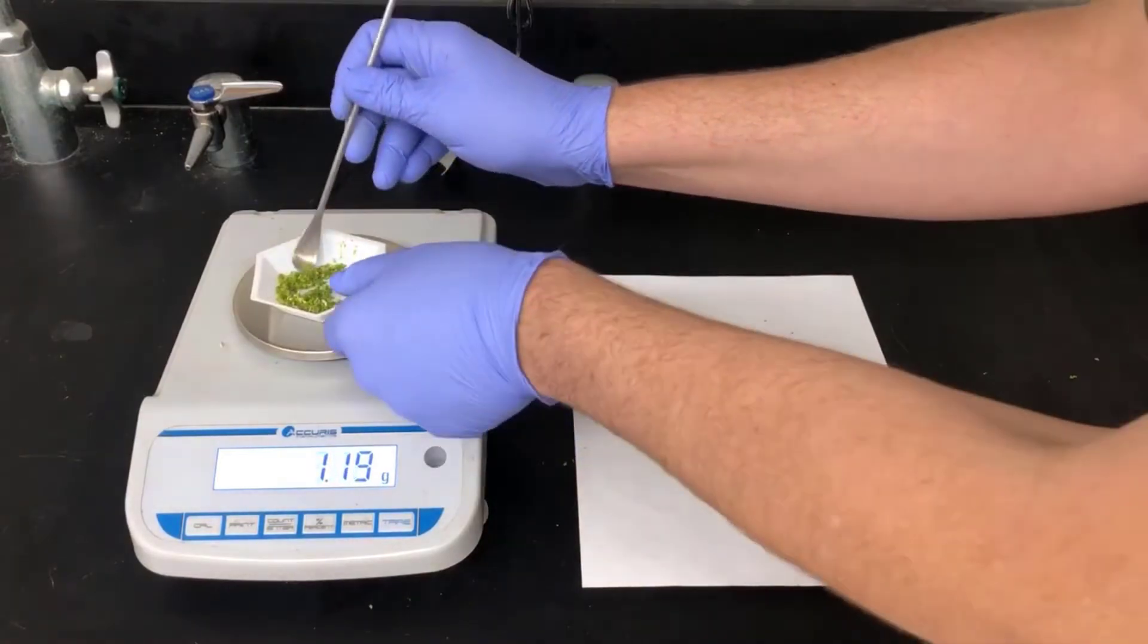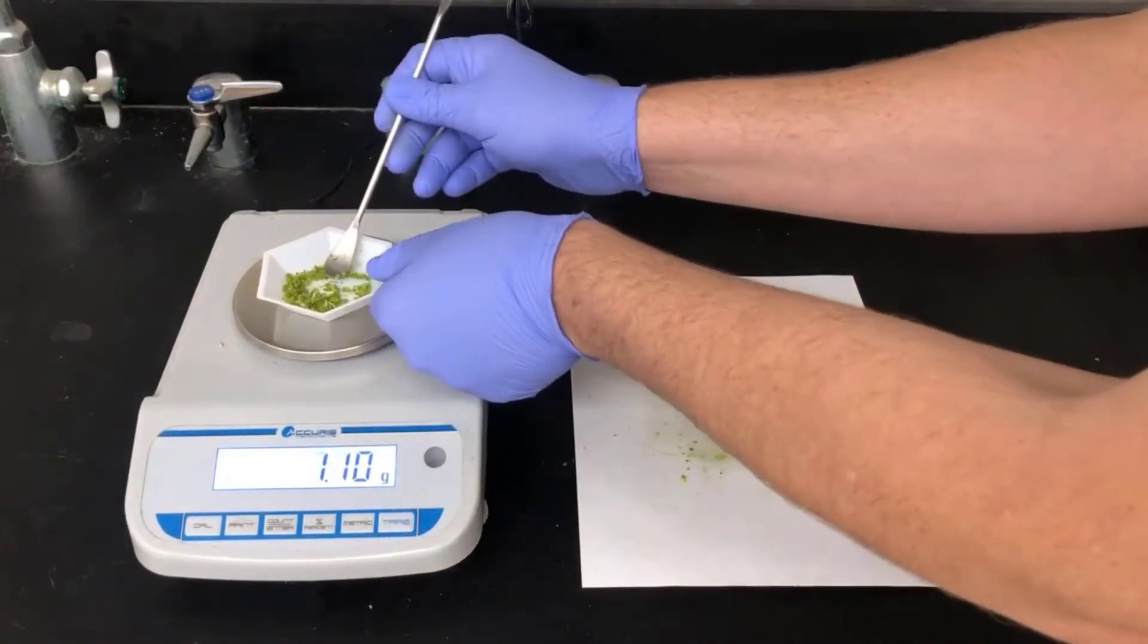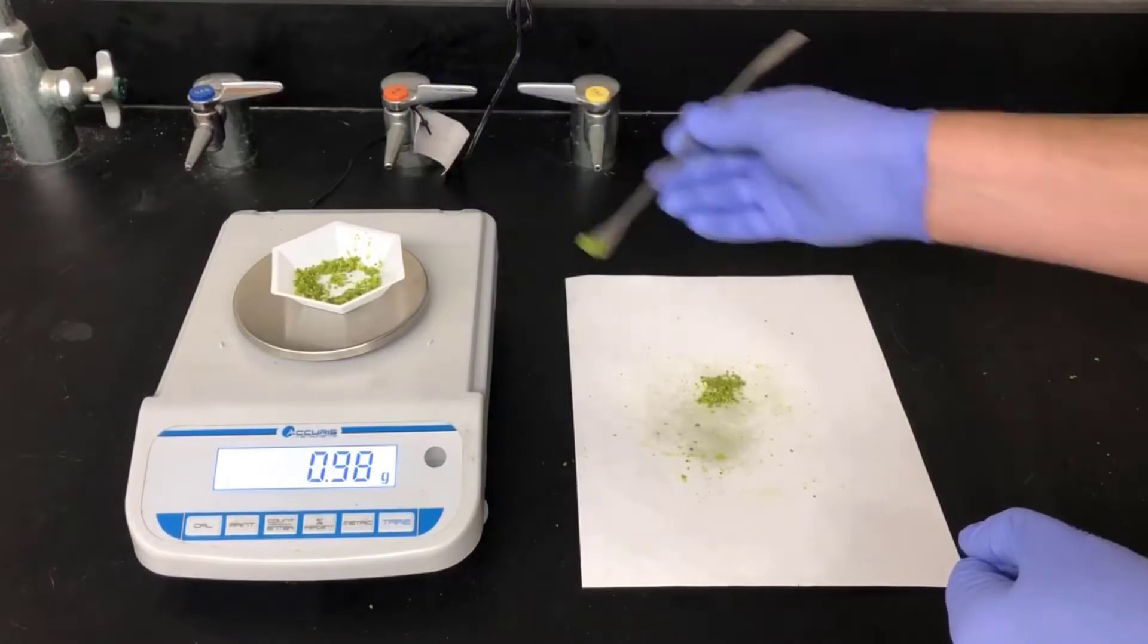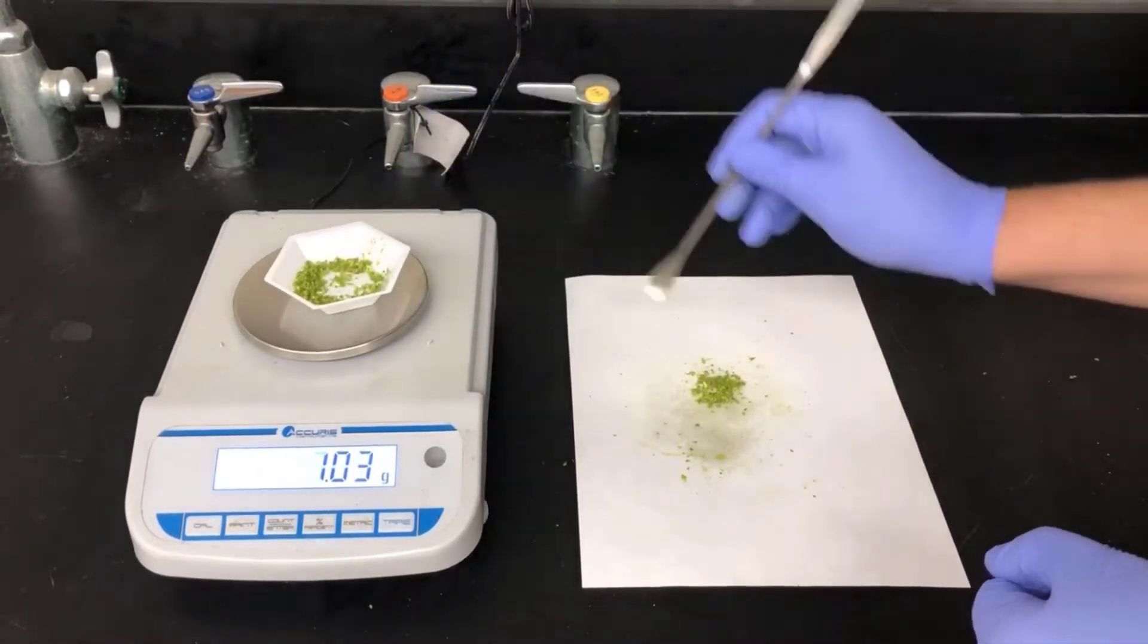It's not a problem to have a little bit more but if you have a lot more it might be hard to fit into the test tube that we're going to use in the next step. So I'll get it down to 1 gram here and then we'll proceed from there.